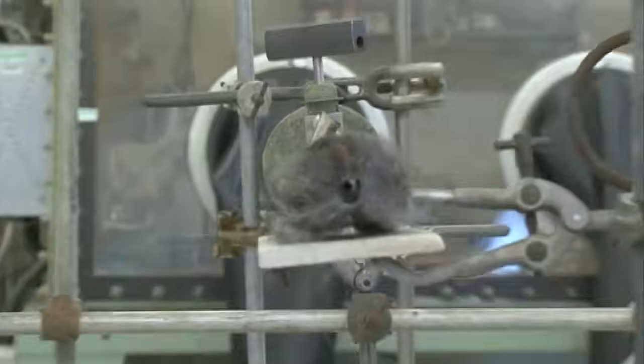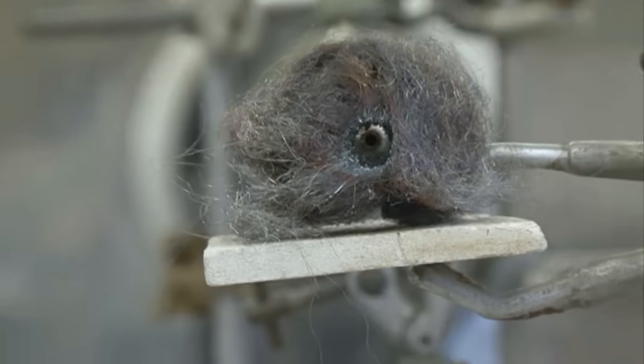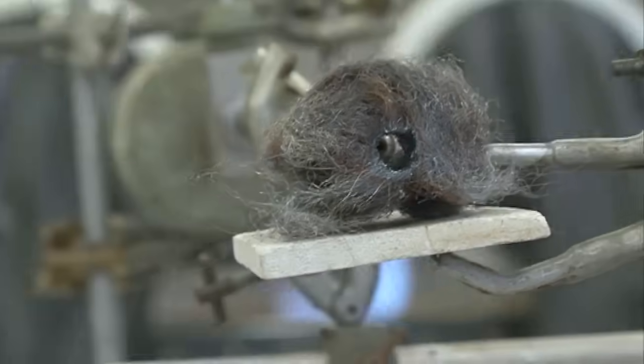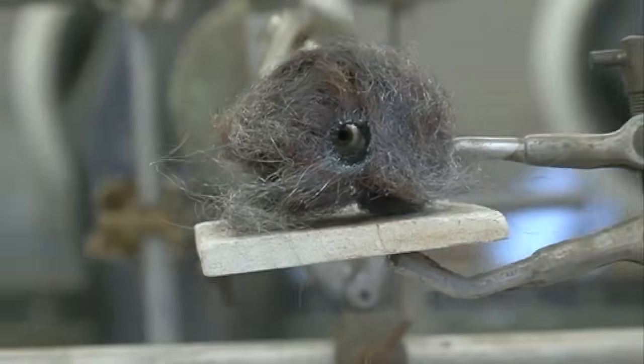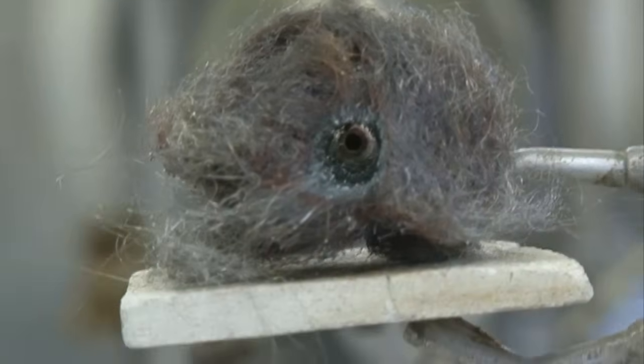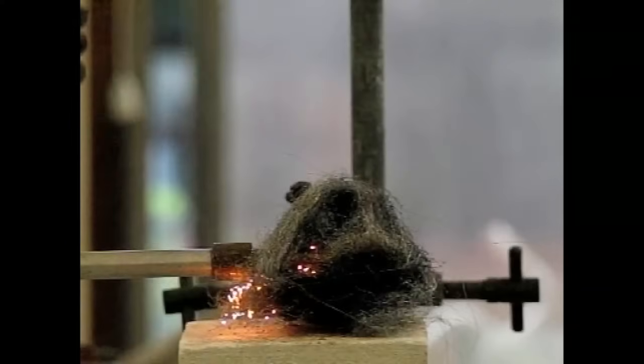It's burnt a hole right through the iron wool. It's extraordinary. The iron looks as if it's rusted, but the rusty colour is actually iron fluoride. Or maybe a bit of iron oxide from the hot iron reacting with the oxygen in the air.